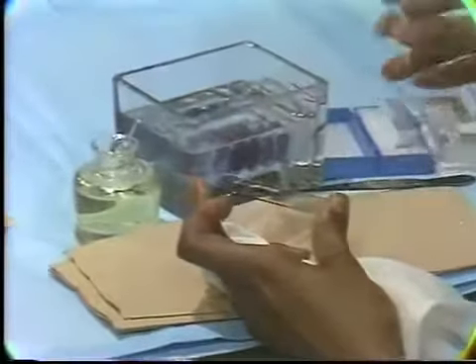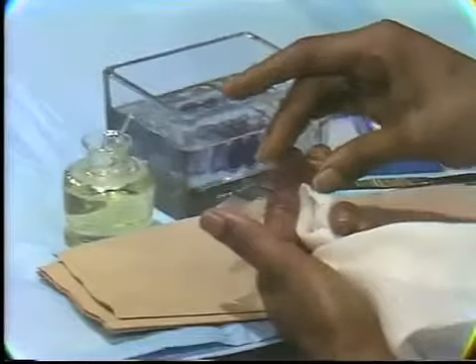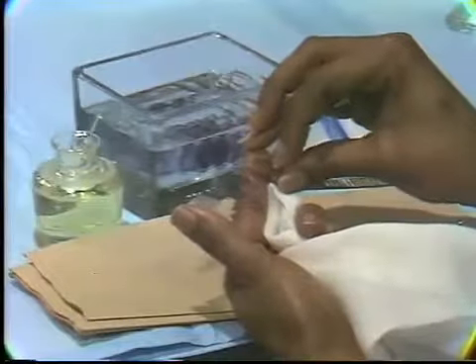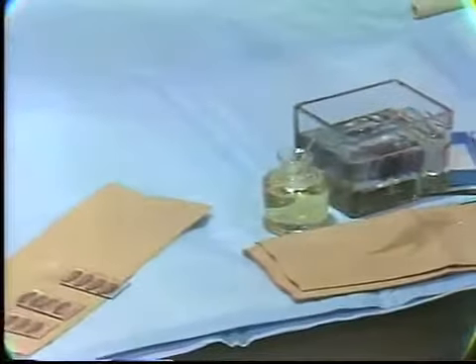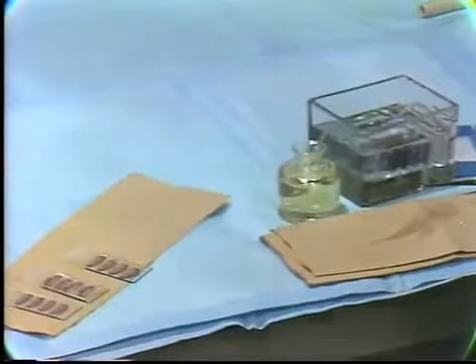And a very thin cover slip, this is a real thin sheet of glass, is placed on top, and it's slightly compressed. And then this will be dried overnight. The mounting media will dry, and then we can observe the tissue sections under the light microscope. Let me review for you now the several steps that we have in the preparation of this tissue section.